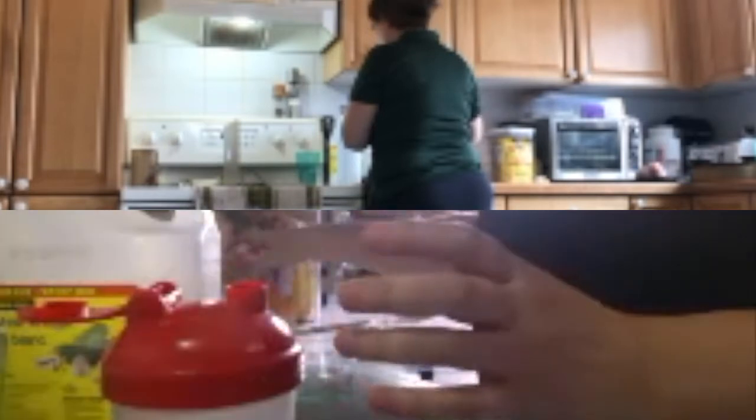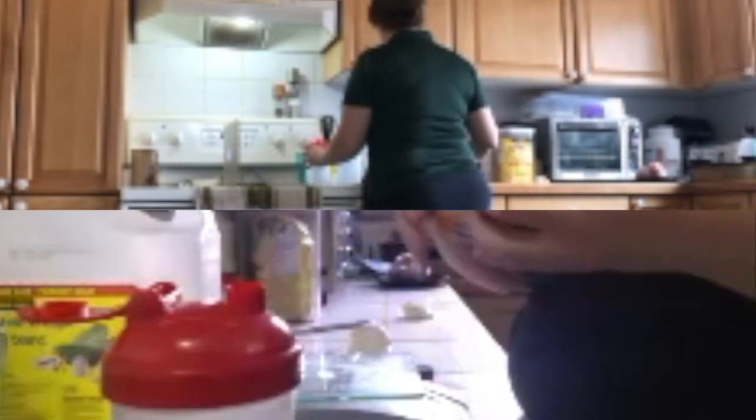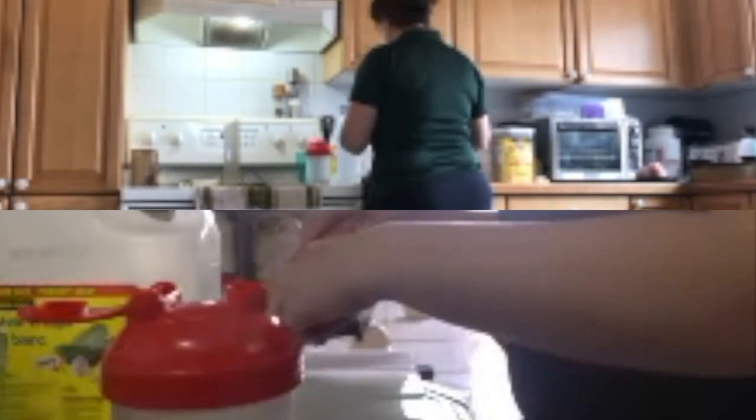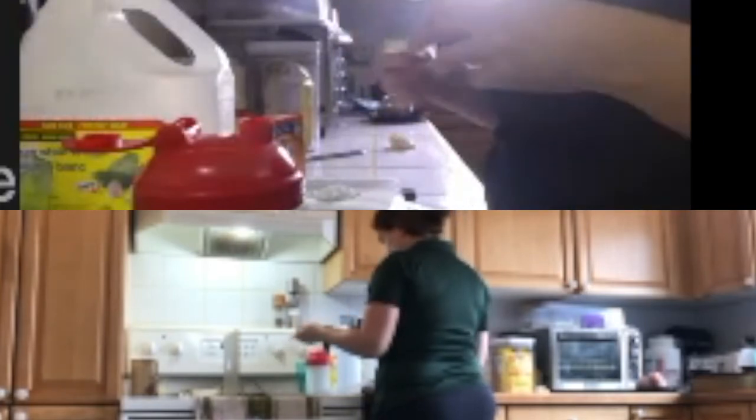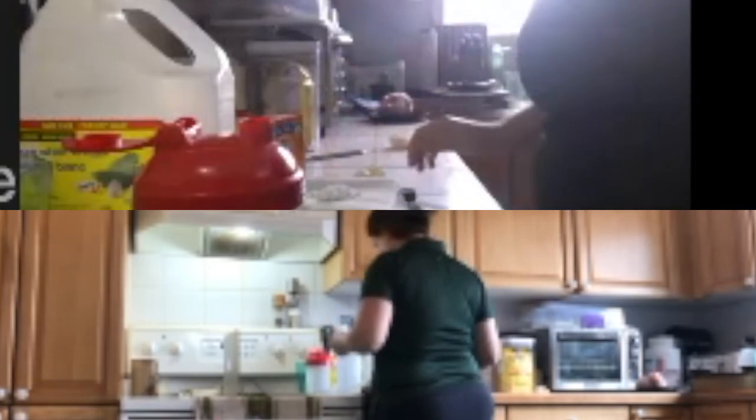Not quite. So, what happens when you react baking soda and vinegar? Gas is formed. And where does the gas go? Yeah, up. And it goes into the atmosphere, right? We can't accurately weigh what goes into the atmosphere. So, I'm going to trap it with the balloon. Hopefully, I'm going to trap a lot of it, most of it.